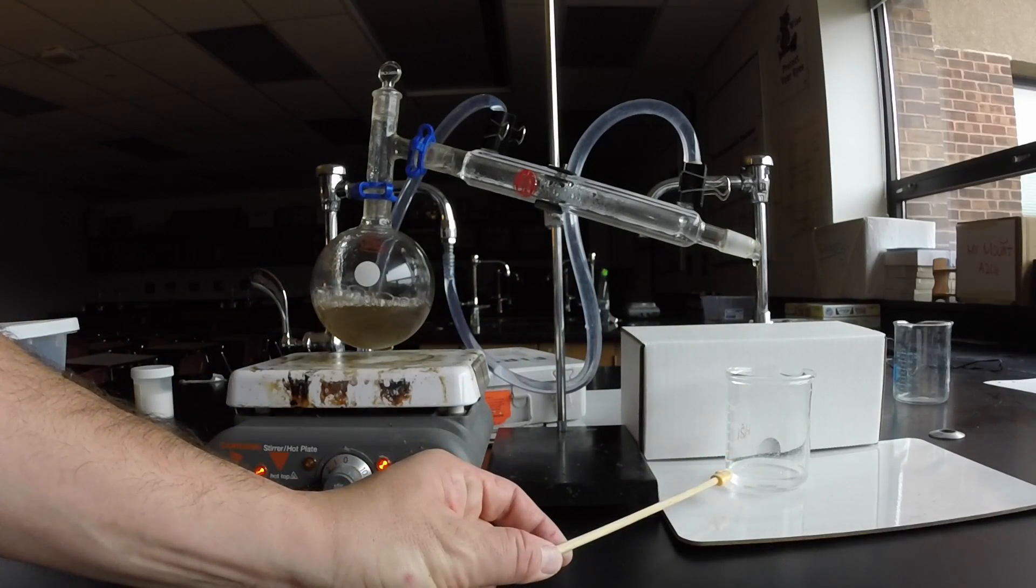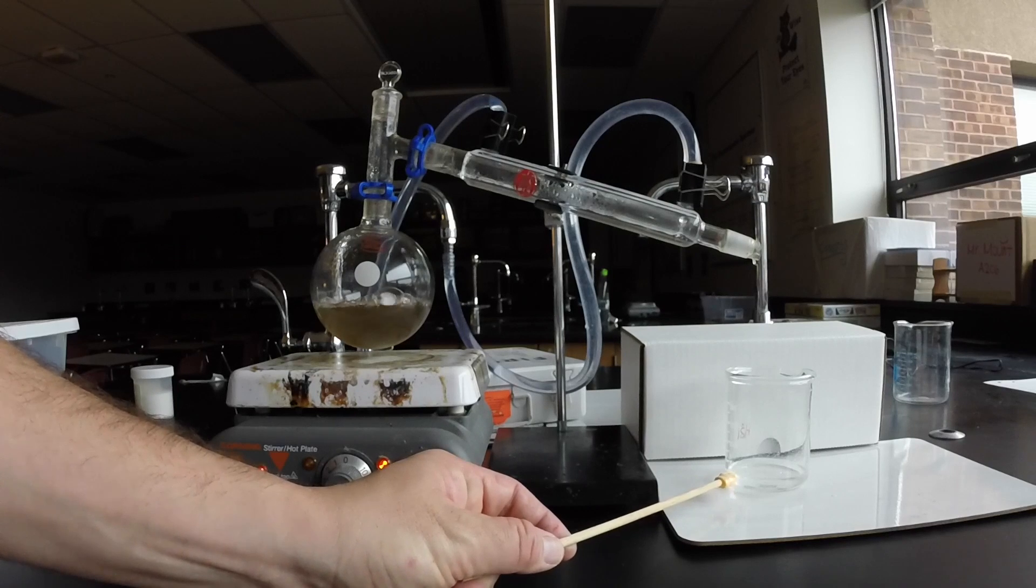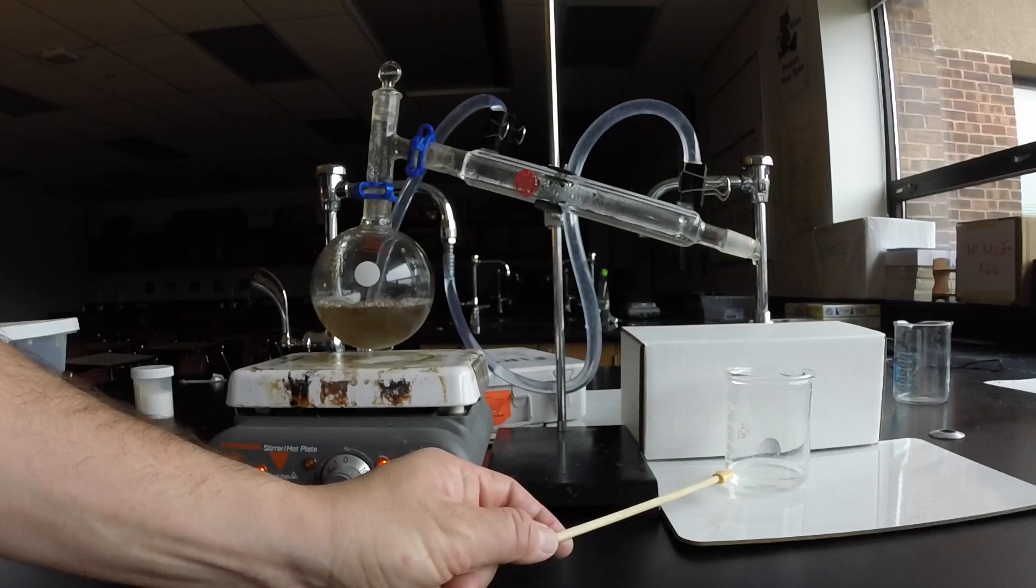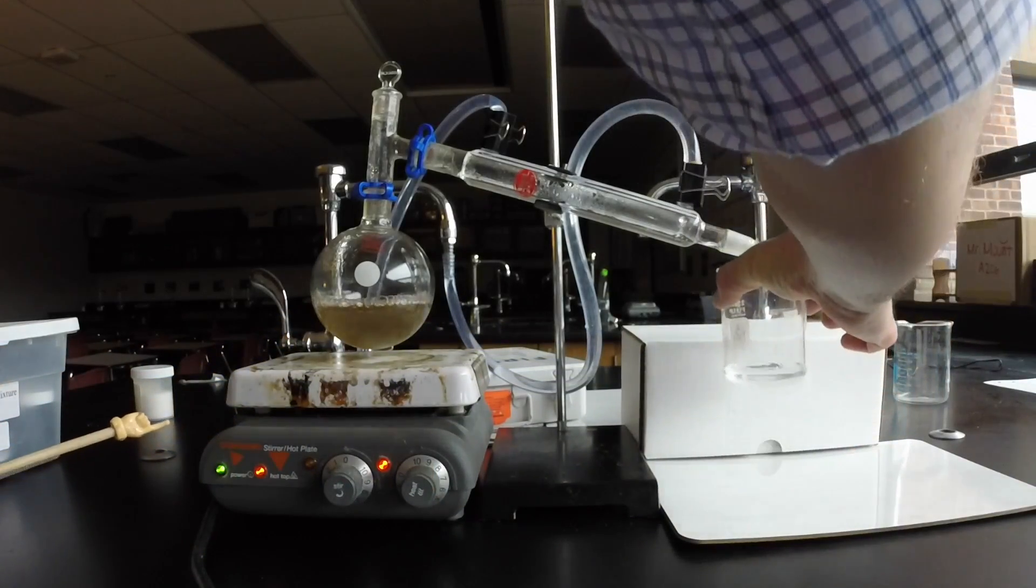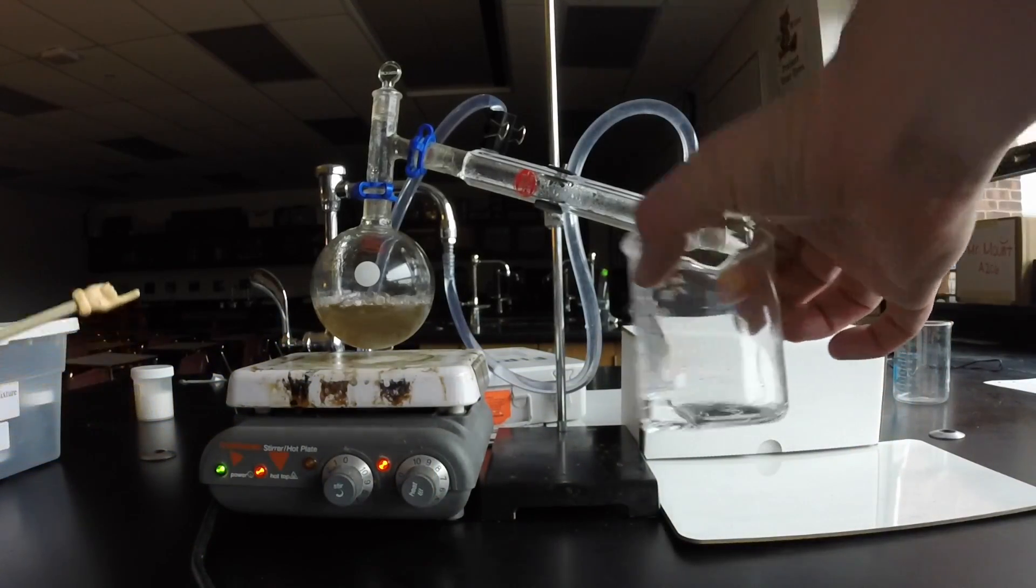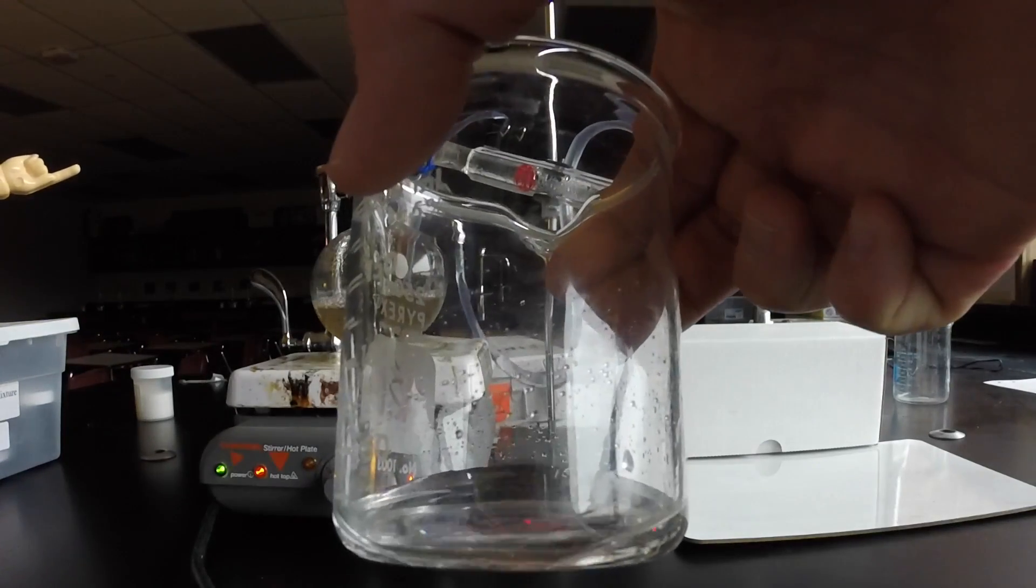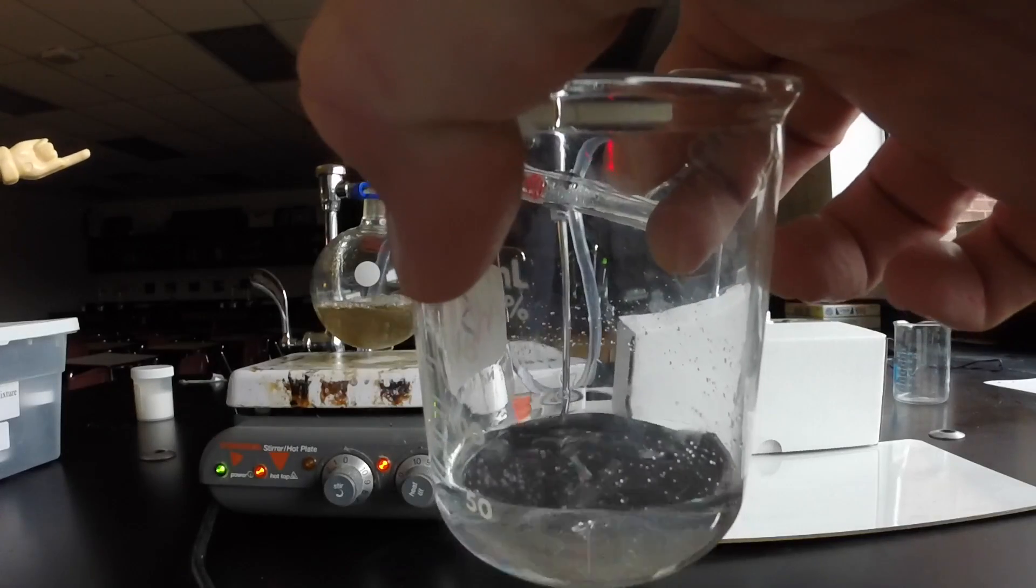So in this beaker right here, we have pure H2O. No salt, no charcoal, no coffee particles. I'll get you a closer look here. There you go. So our beaker, pure, clear H2O, obtained from distillation.